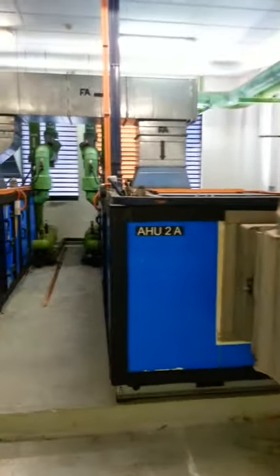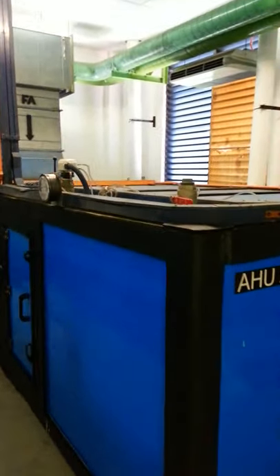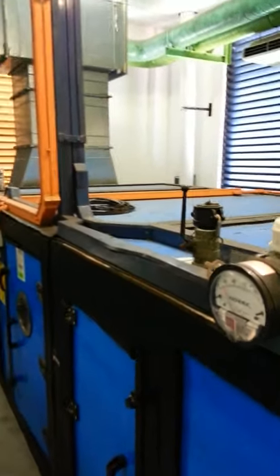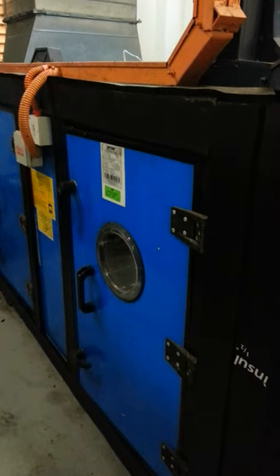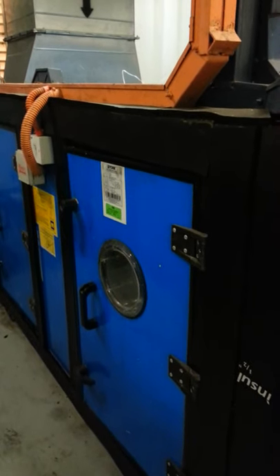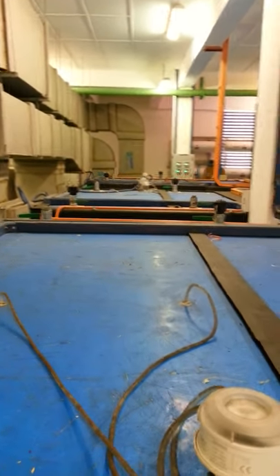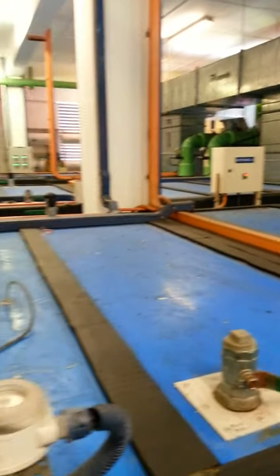This over here in blue is the air handling unit. The air handling unit comprises a HEPA filter which filters all the air that enters this facility, and as you can see, these filters can be opened for periodic maintenance and for replacement of the filter modules. All the air entering this facility is filtered through this HEPA filter, and the air which exits this facility is filtered through these HEPA filters as well.